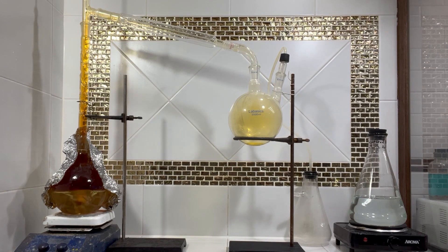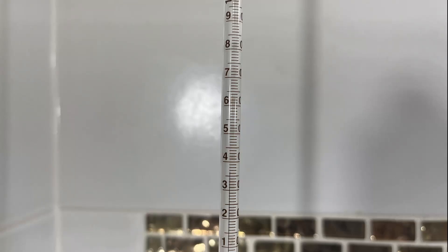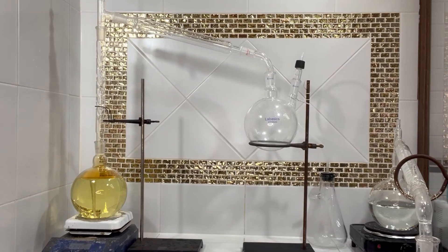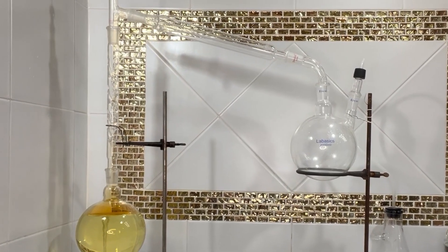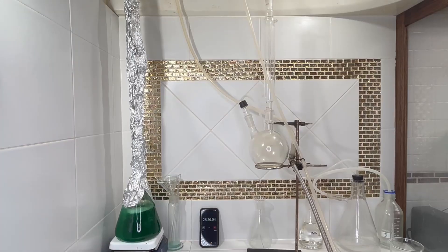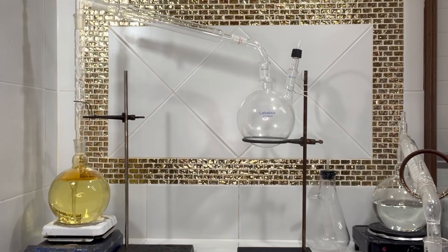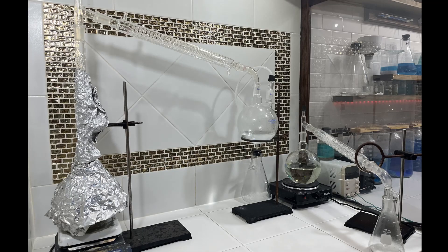So I know there's a lot of good information online about how to set up a distillation apparatus, but I wanted to run some experiments for myself. I used a glass thermometer, I used a digital thermometer, I used one condensing funnel and I used two condensing funnels, I used spiral condensers and Vigreux condensers. It's these types of experiments that give us the experience that we all desire.